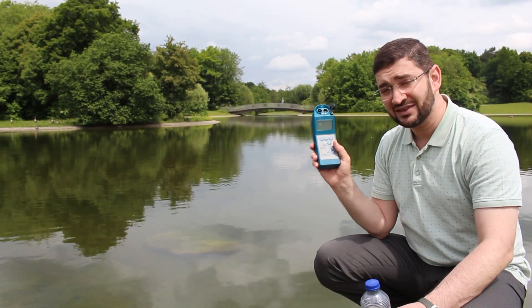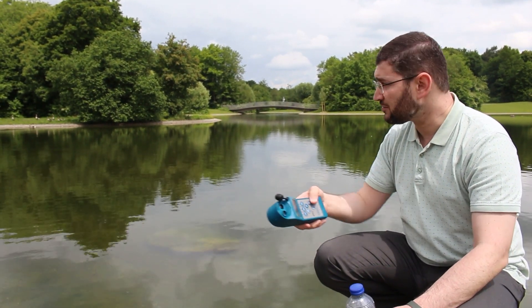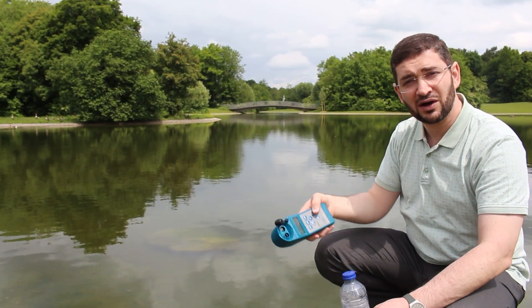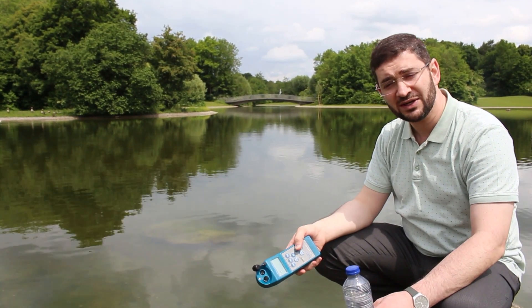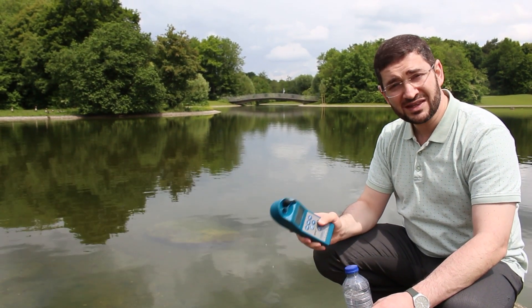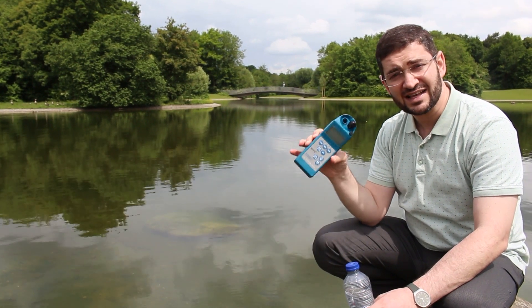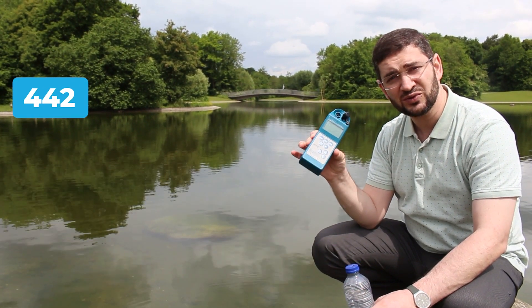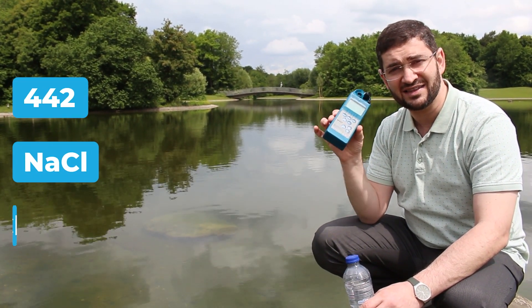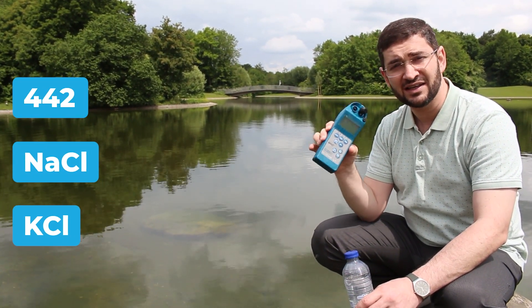Here we are going to measure the TDS of this water body — this lake in a park in Munich, Germany — and we can see together the difference between TDS measured as 442, as NaCl, and as KCL.